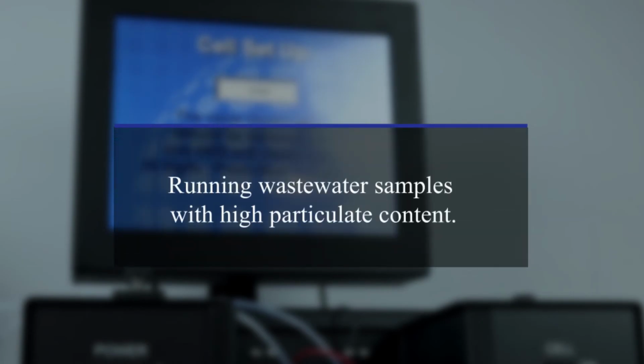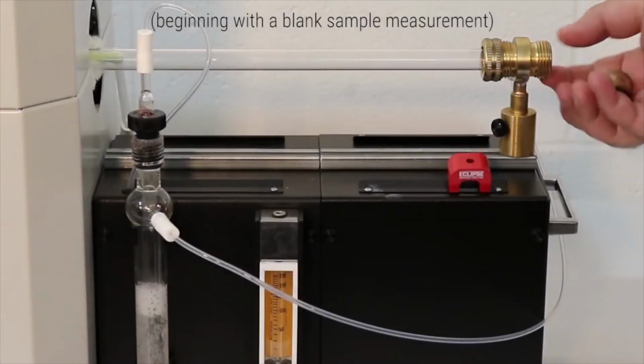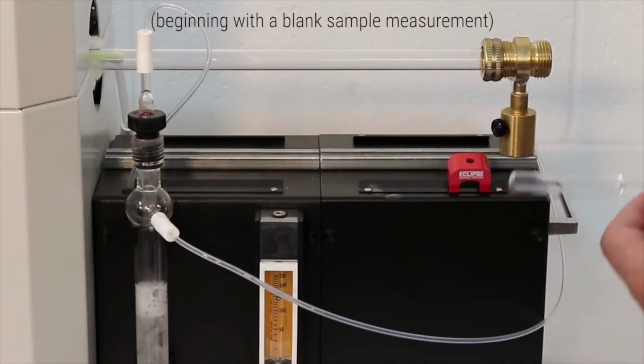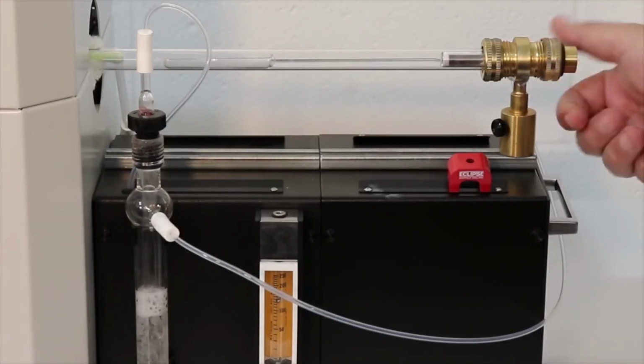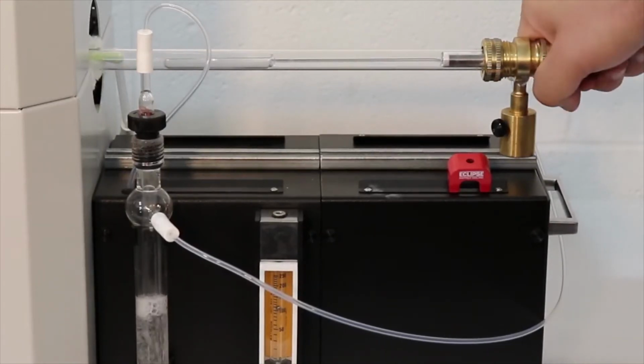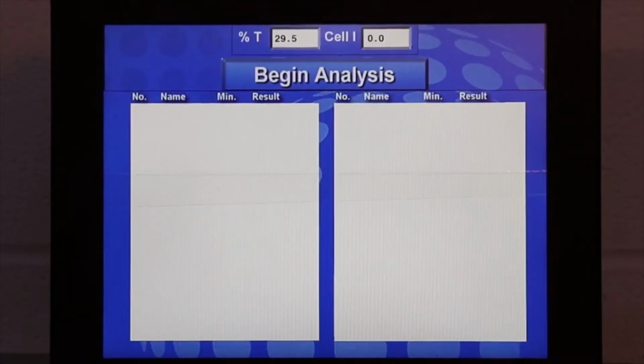Running wastewater samples with high particulate content. Remove the capped end on the breech block and insert the ladle. Hand tighten the capped end back. Be careful not to break the combustion tube. Wait for the system to purge any CO2 trapped inside.